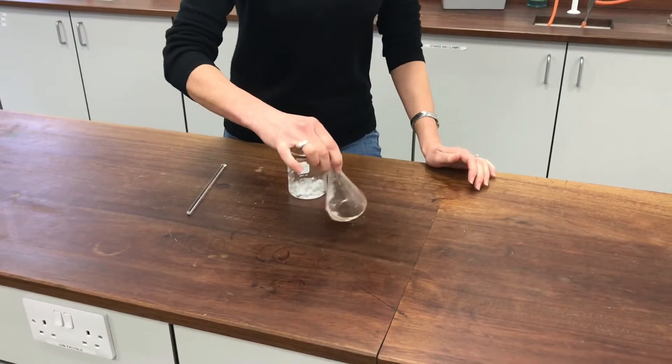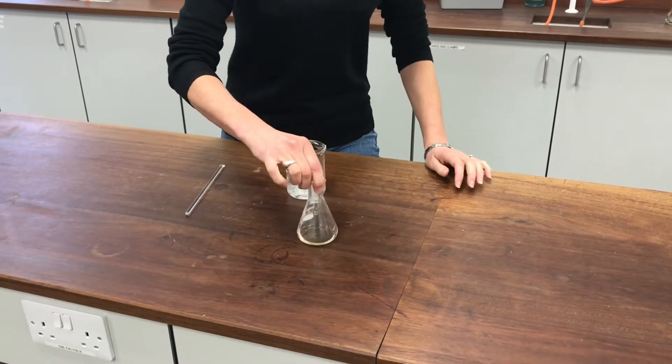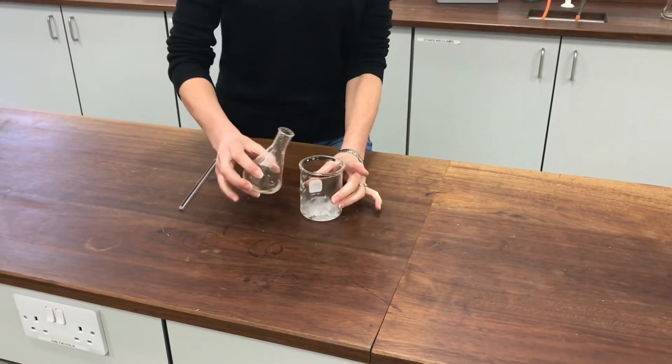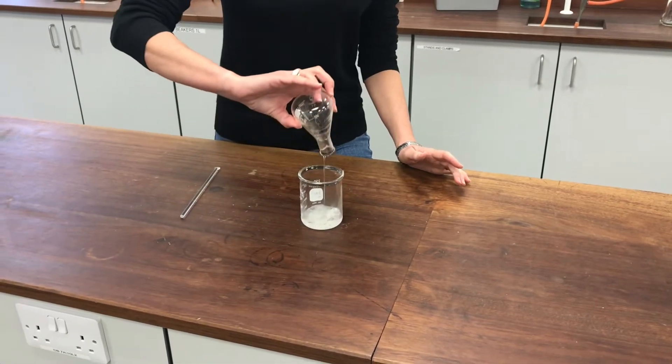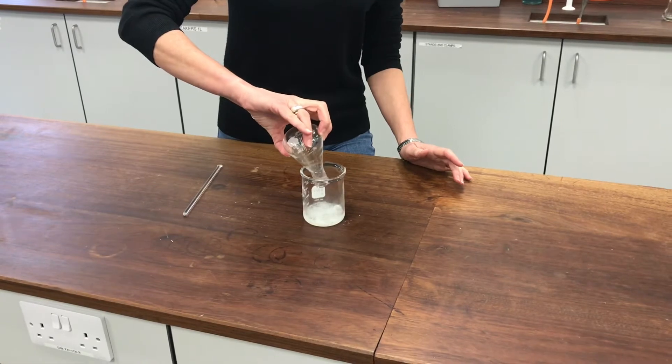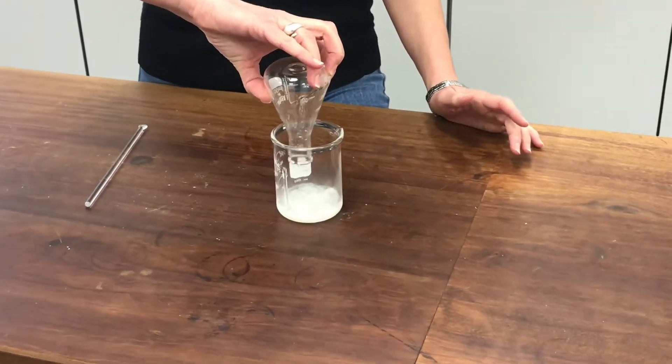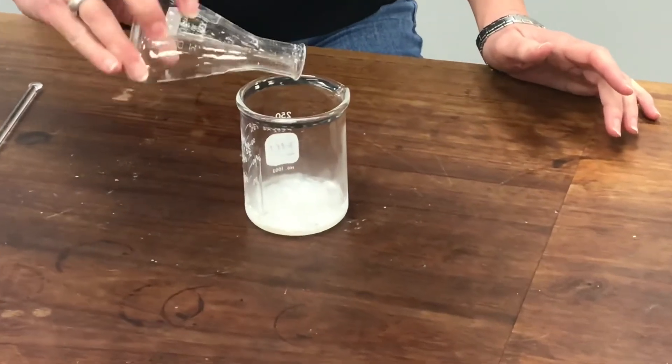So this has now been standing at room temperature for at least 15 minutes. In fact, almost 20 minutes. I've now got to pour it over some crushed ice. And you can see it's already starting to look a little bit cloudy as the nitrated product is starting to crystallize out.